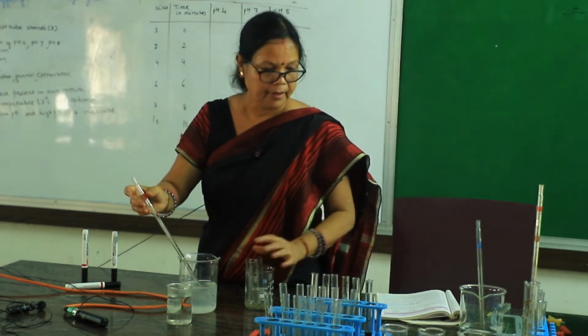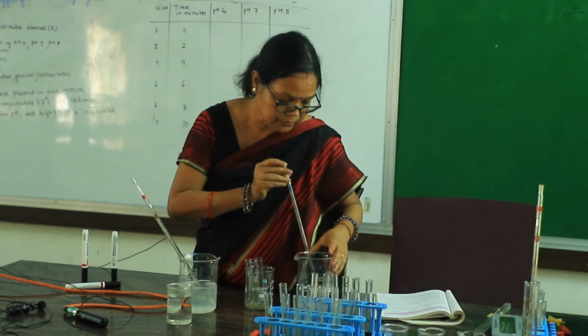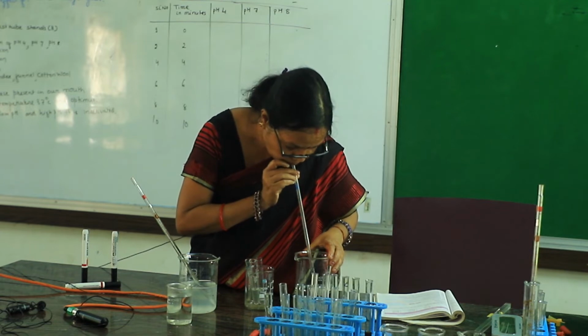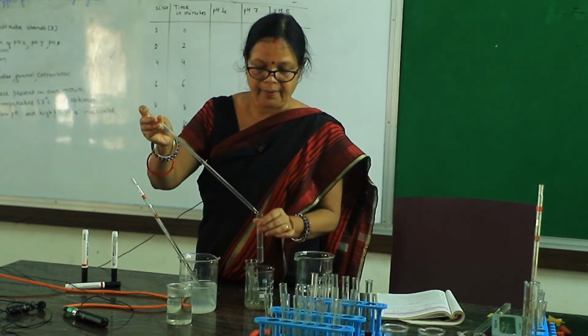Okay. Next, you have to add 1 milliliter sodium chloride. Sodium chloride generally activates our amylase.